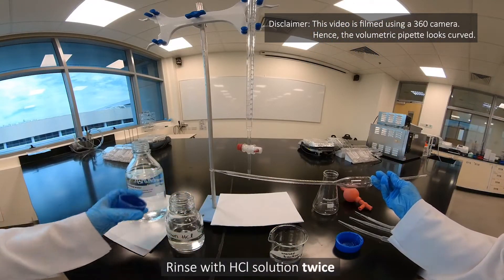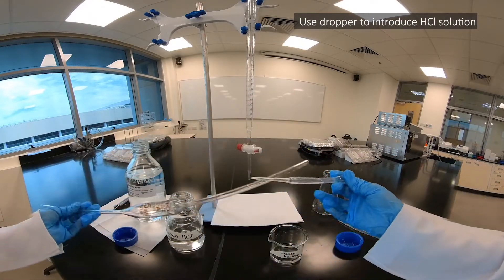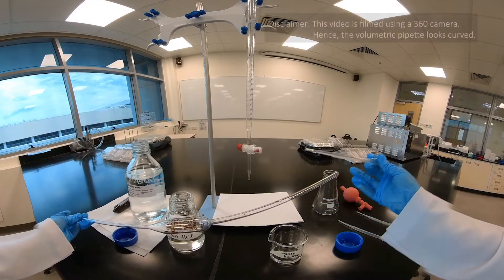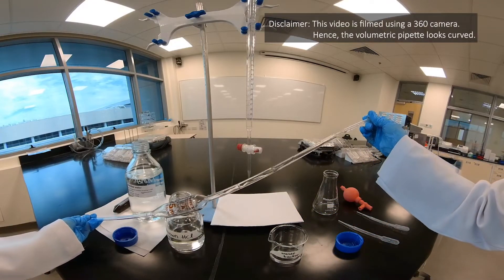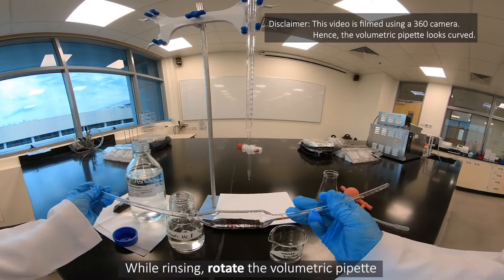Rinse with HCL solution twice while rotating the volumetric pipette.